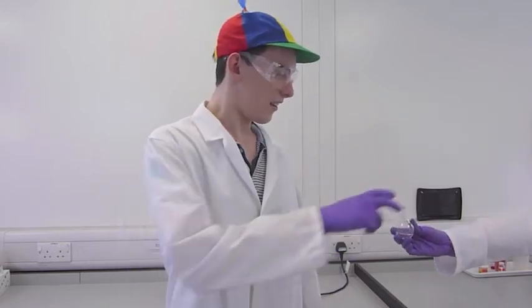Back in the lab, and your distillation is complete. Here's your finished product. Awesome! I can't wait to show my friends at school!